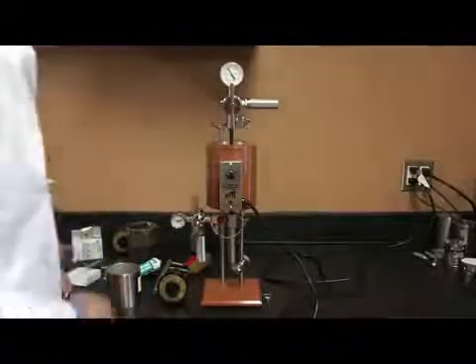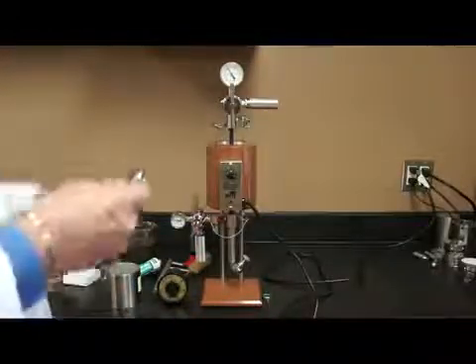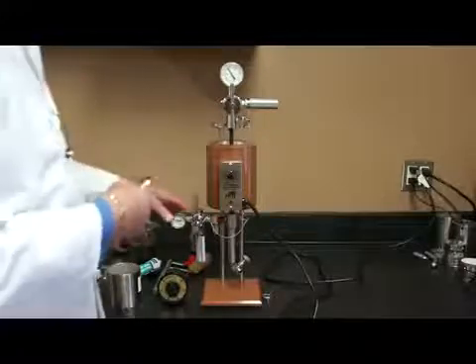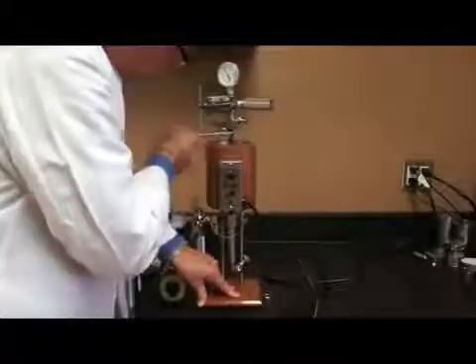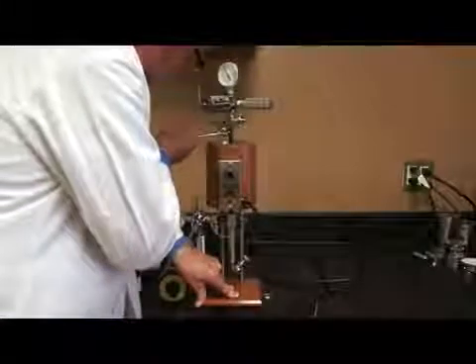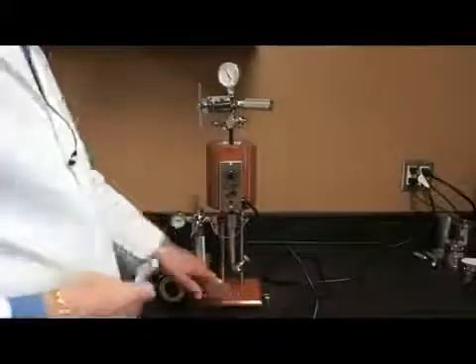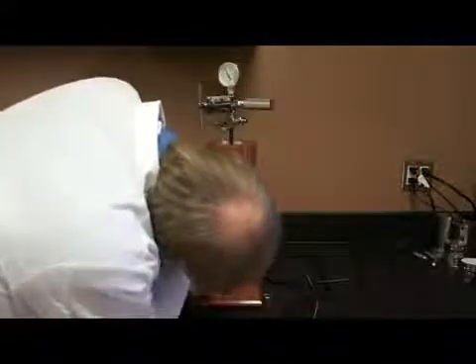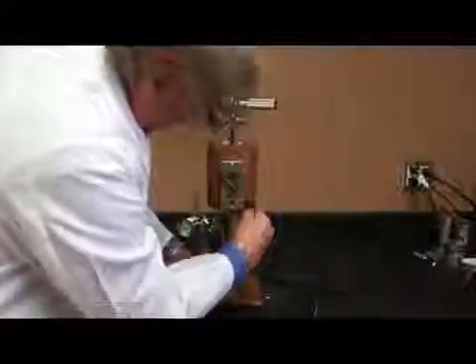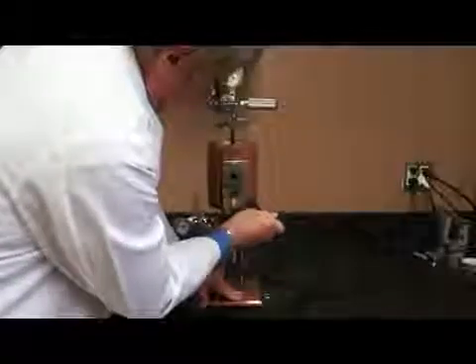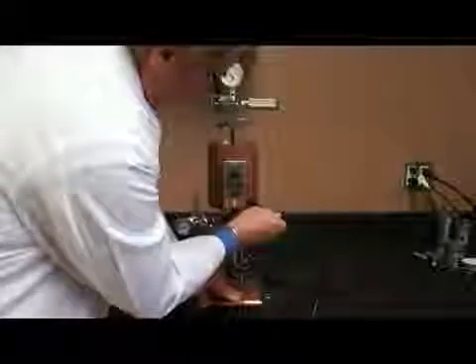But at the conclusion of the test, the first thing I want to do, and this is very important, is I want to seal off the cell. And I do that by closing the valve stems. So I'm going to close the valve stem on the top. This will keep any pressure from going into the cell. Now I'm going to do the same thing on the bottom, being mindful that this is in reverse. So I'm going to tighten. All righty, so now the cell is sealed off.